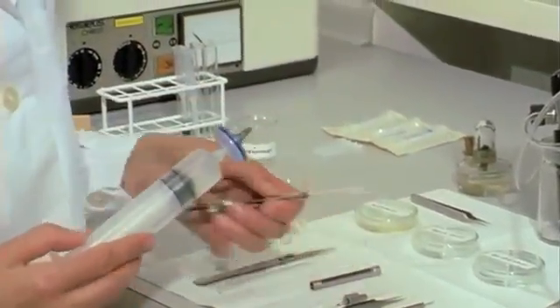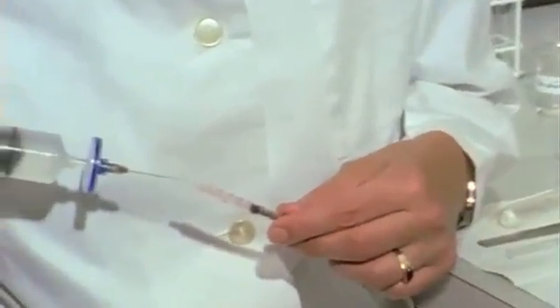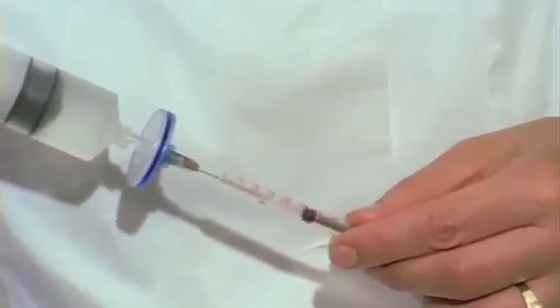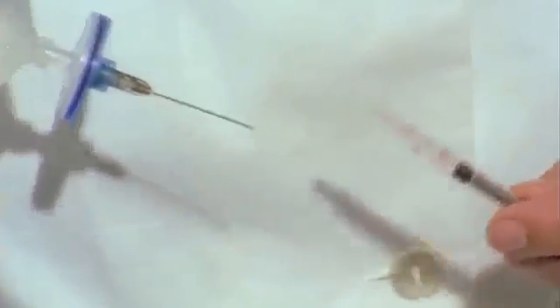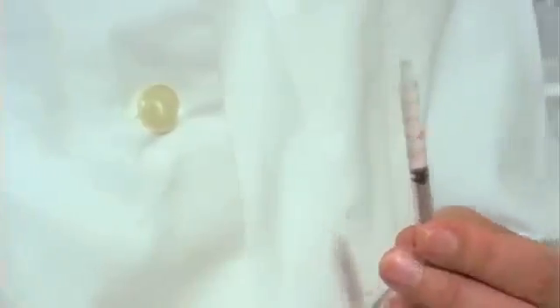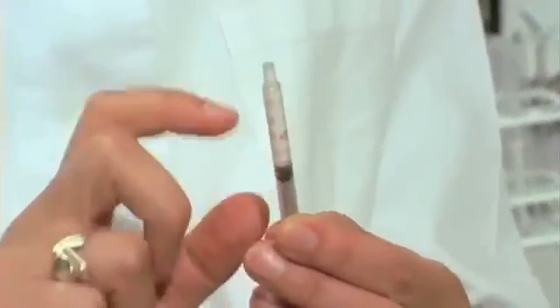Now the insemination syringe is filled with the buffer solution. Bubbles of air are carefully removed.